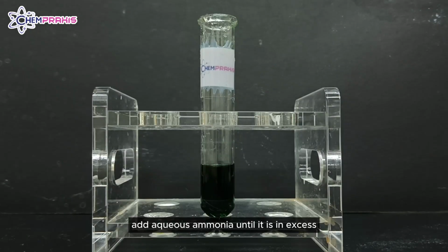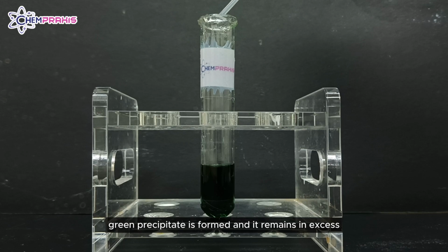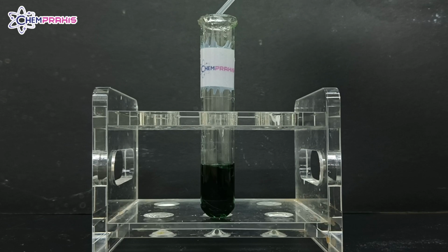Add aqueous ammonia until it is in excess and no further changes can be seen. We can see that gray-green precipitate is formed and it remains in excess.